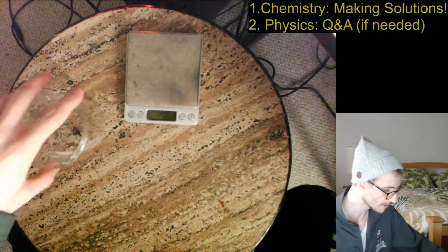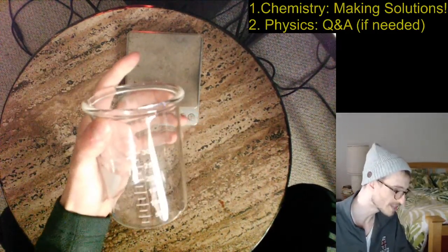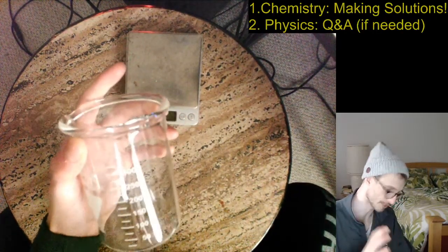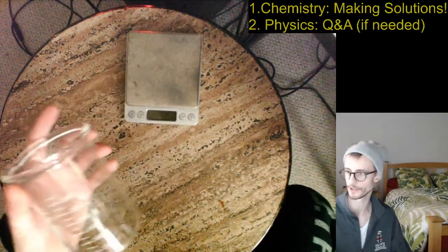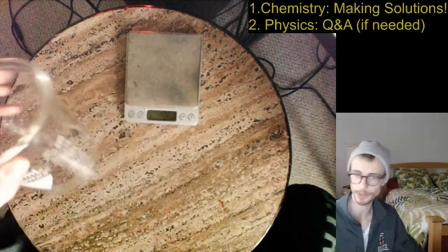So 100 milliliters, that's about the same as 1/10 of a liter. So if you imagine a 1 liter bottle, we're going to fill it 1/10 full. Now I could do more liters and more volumes, but I would just need more salt and sugar, so it's a little bit arbitrary.